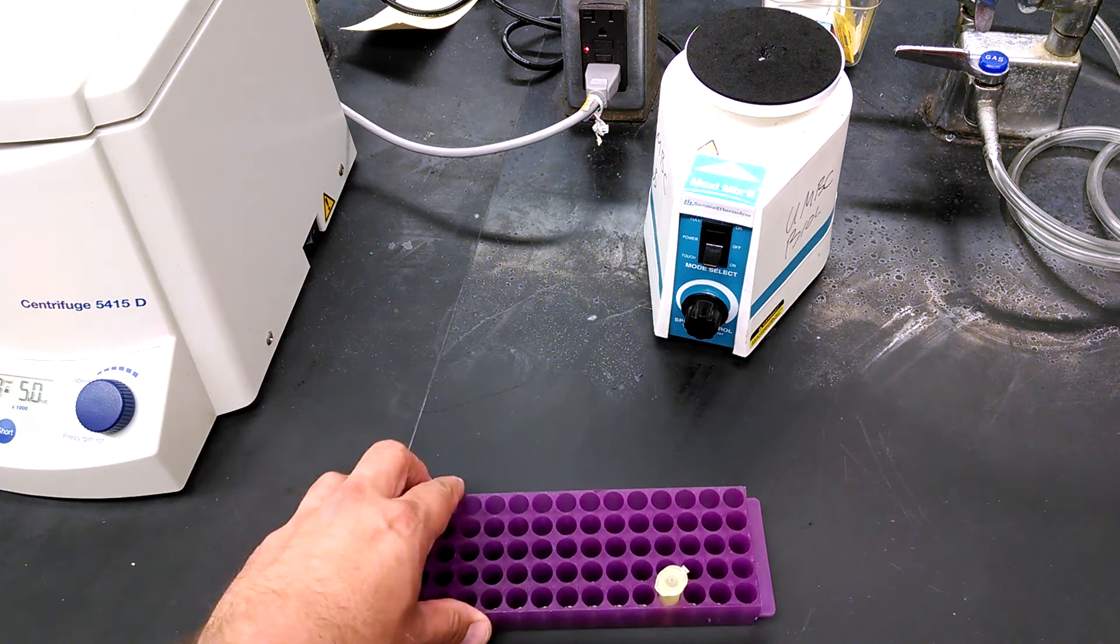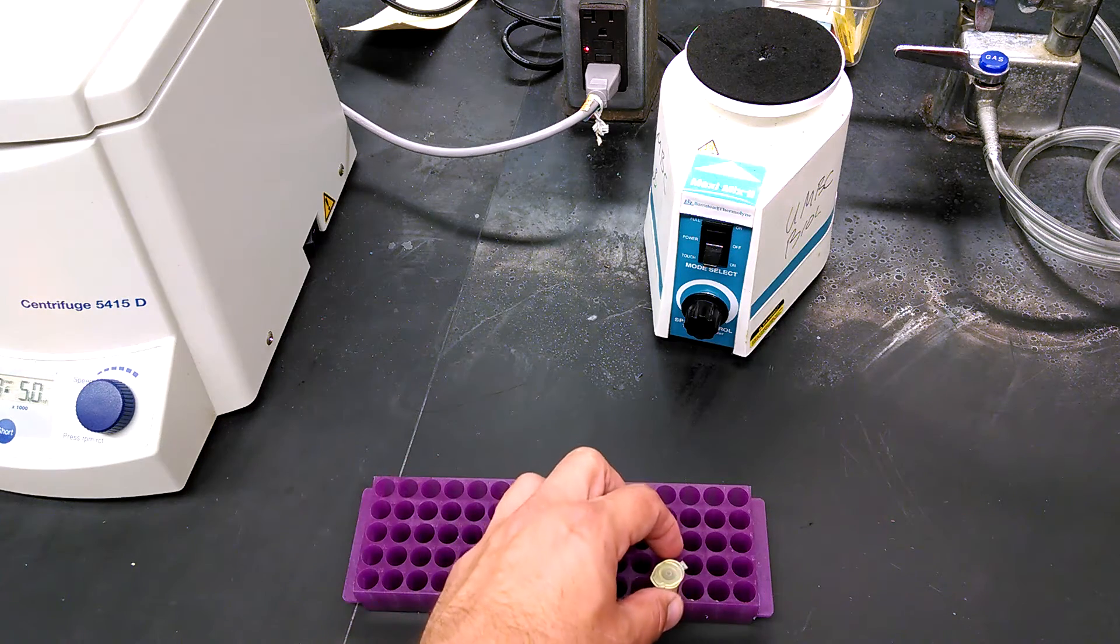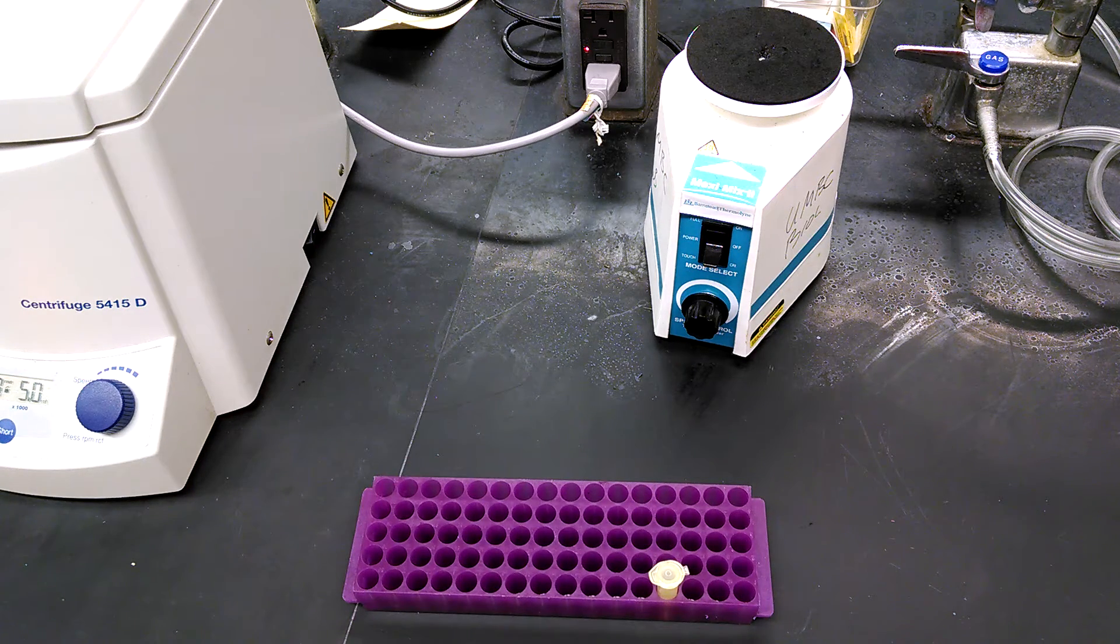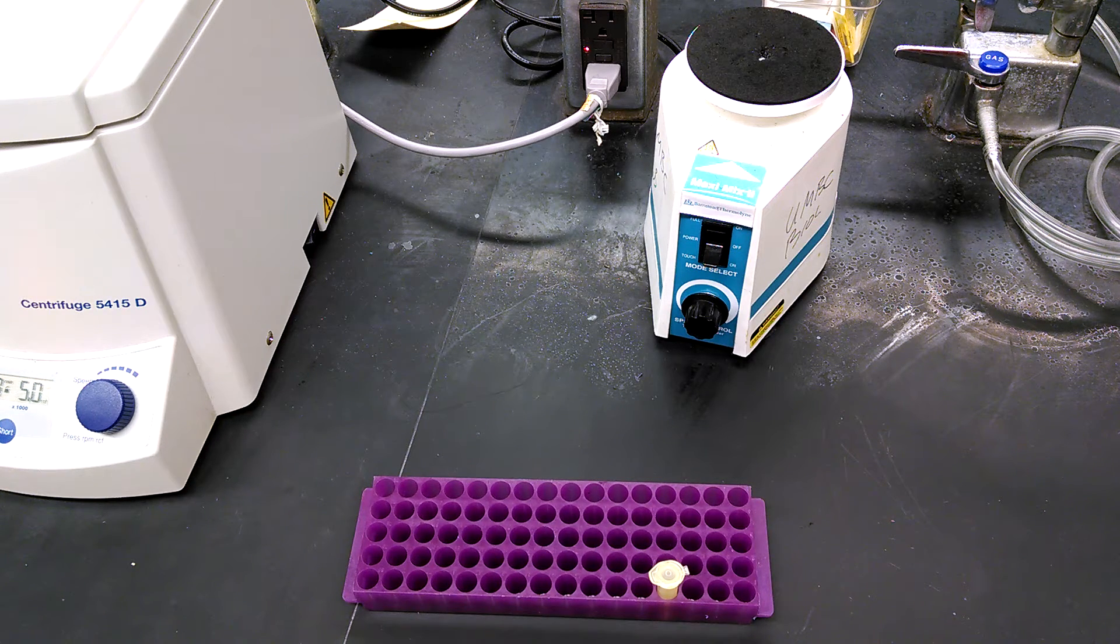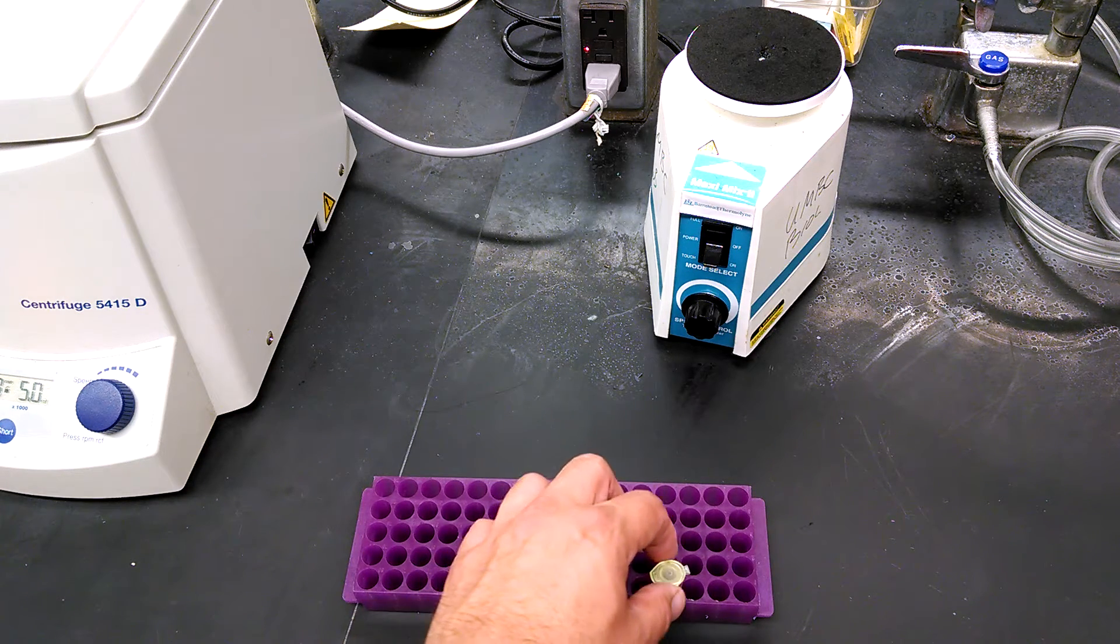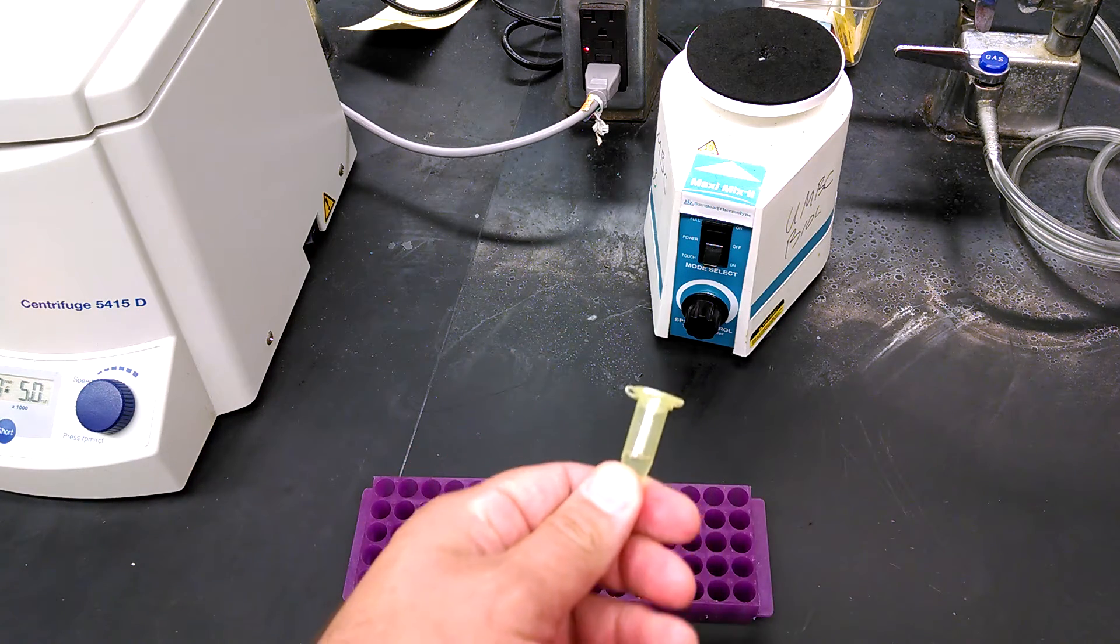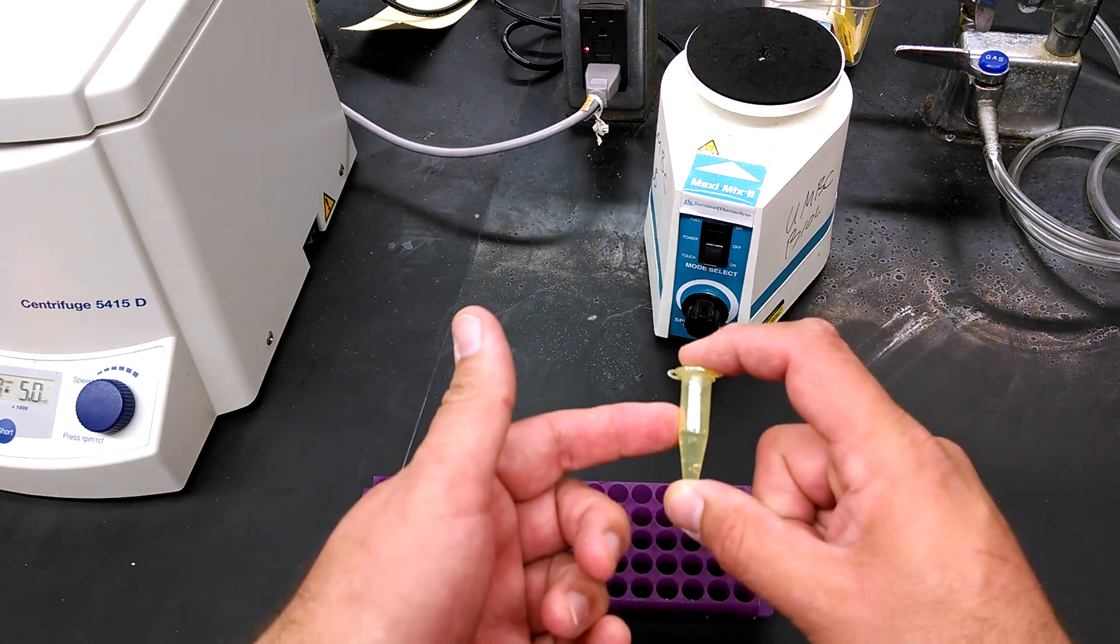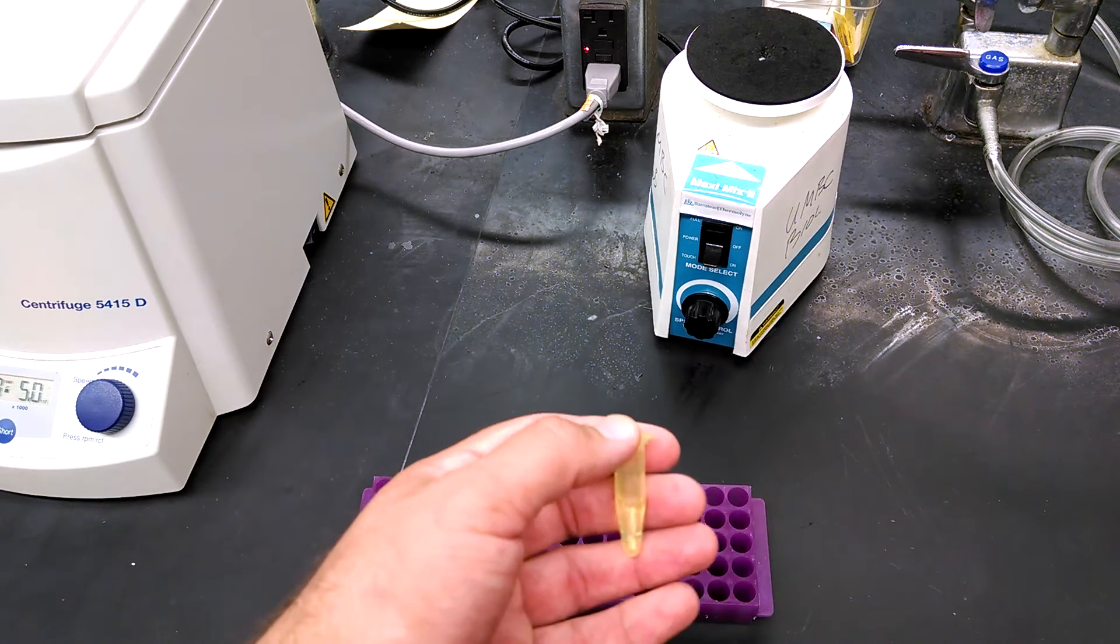At this point, you're partly through the procedure. You've taken a cup filled with sterile saline out of the lab, because we can't put anything in our mouth inside the lab, swished it around and spit it back into the cup, and then pipetted one mil of that sample into a fresh, sterile microcentrifuge tube. And here you have it in front of you.